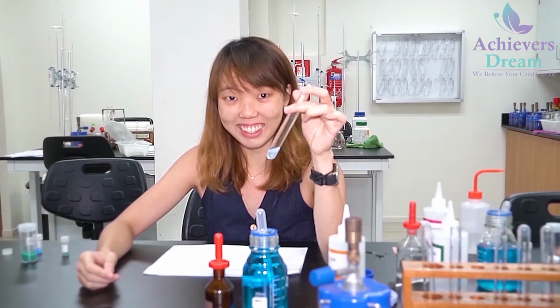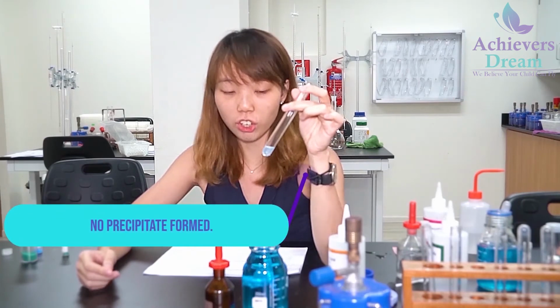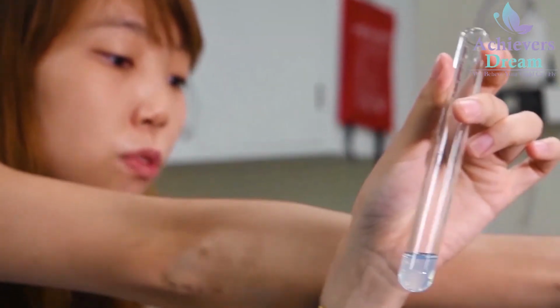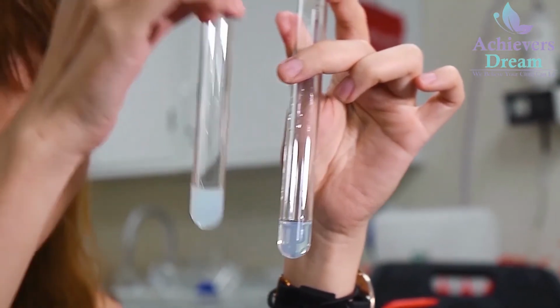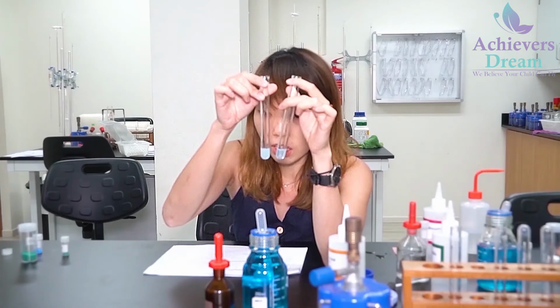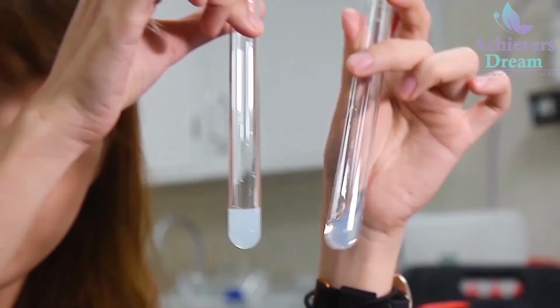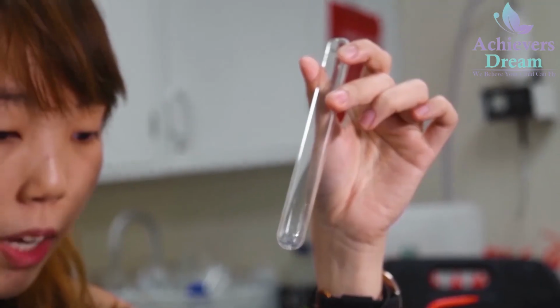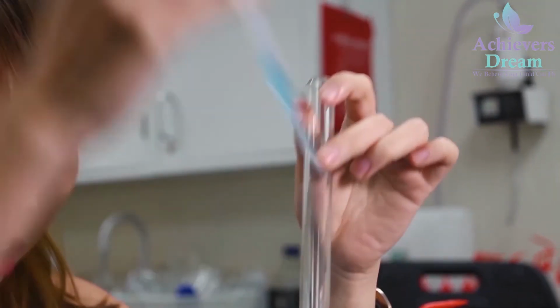There is no visible change, so you can see that there's no precipitate formed. If you compare it to solution R, where there's white precipitate, here there is no precipitate formed.